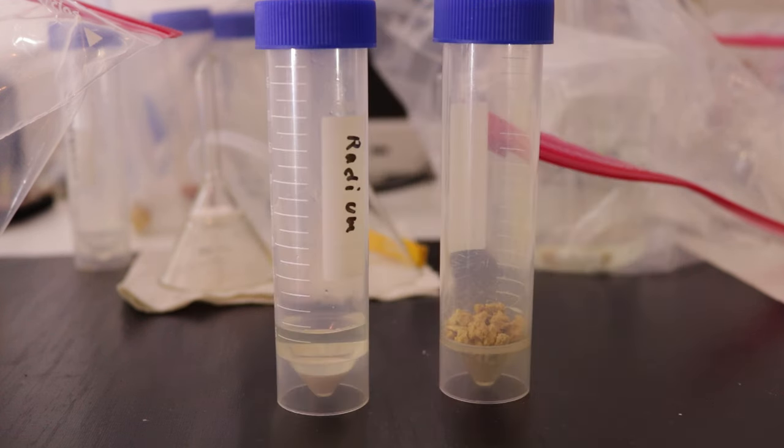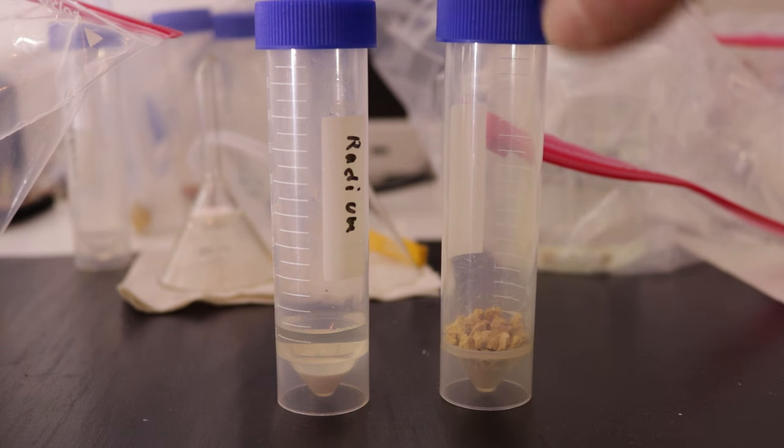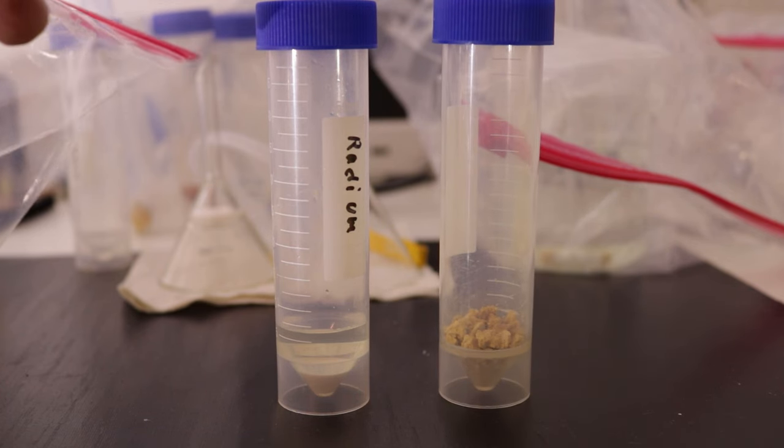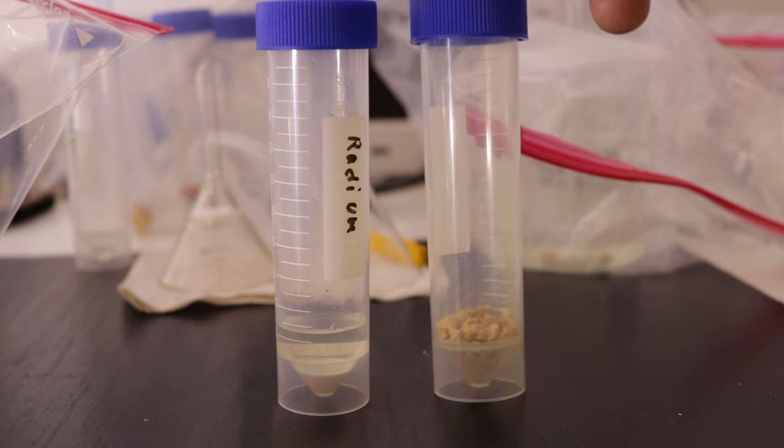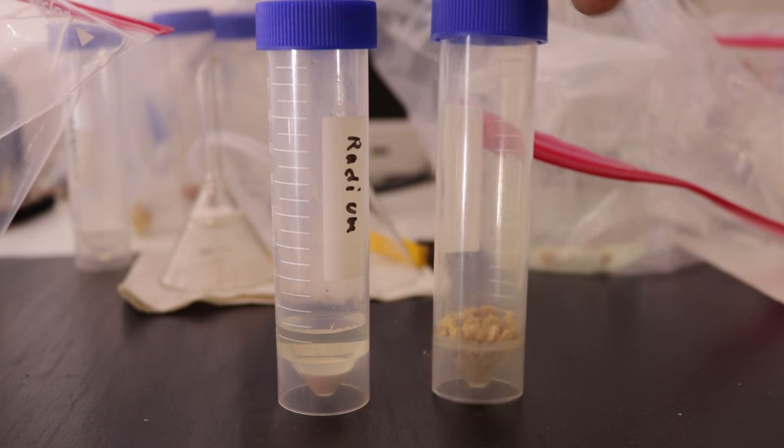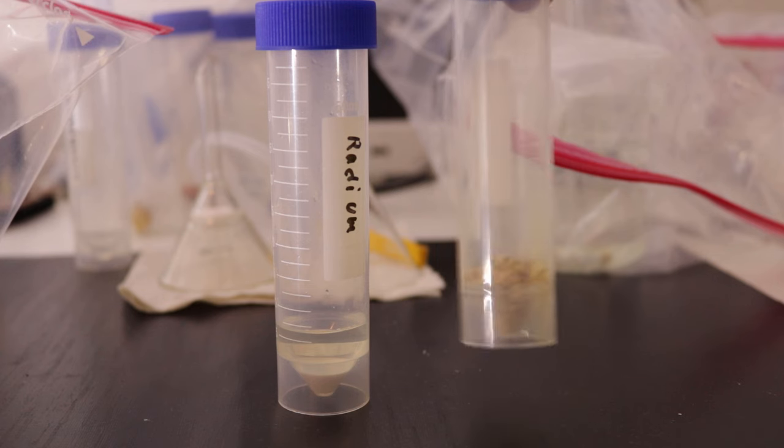Are you guys ready for the incredible yield of uranium? Yeah it's not much. It's maybe a couple grams. I forgot to weigh it and it's inside the container now. But there's still a couple of bits in the beaker I dried it in, and obviously there's still a bunch in the original solution from the ore. So there's still a lot to be extracted, but for now this is pretty okay.